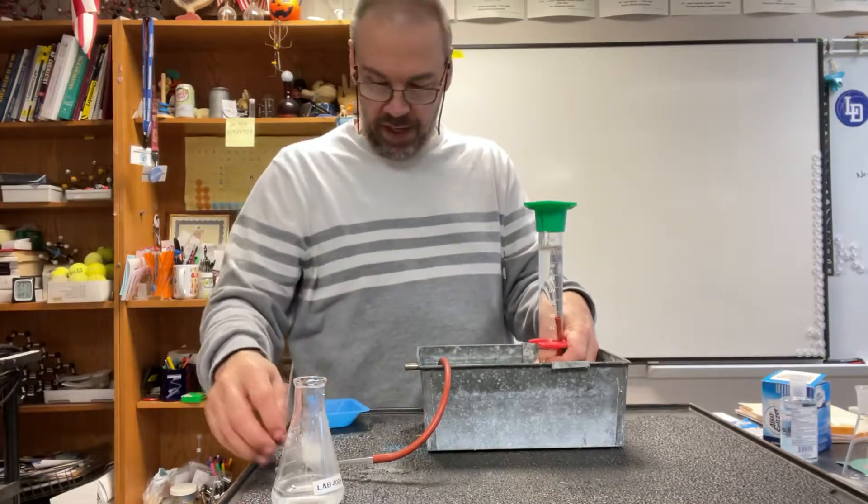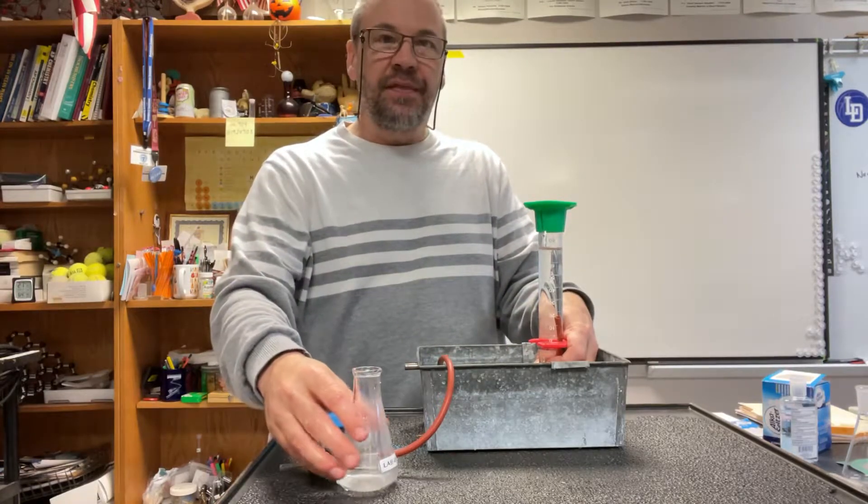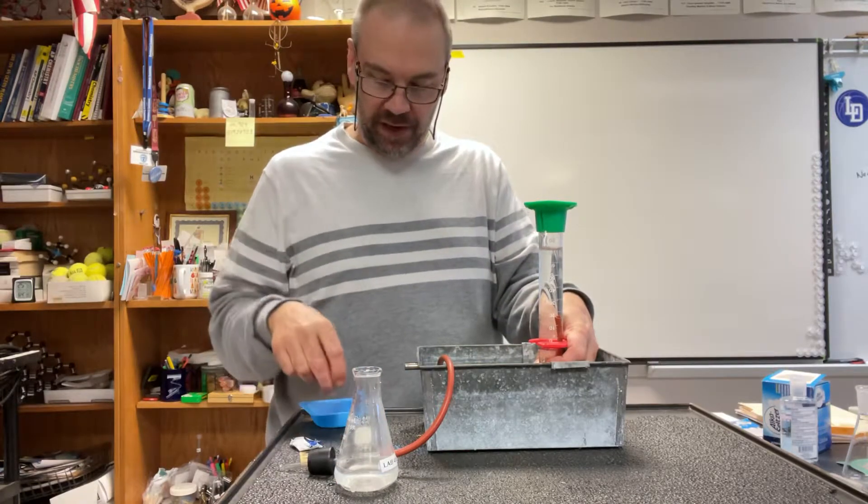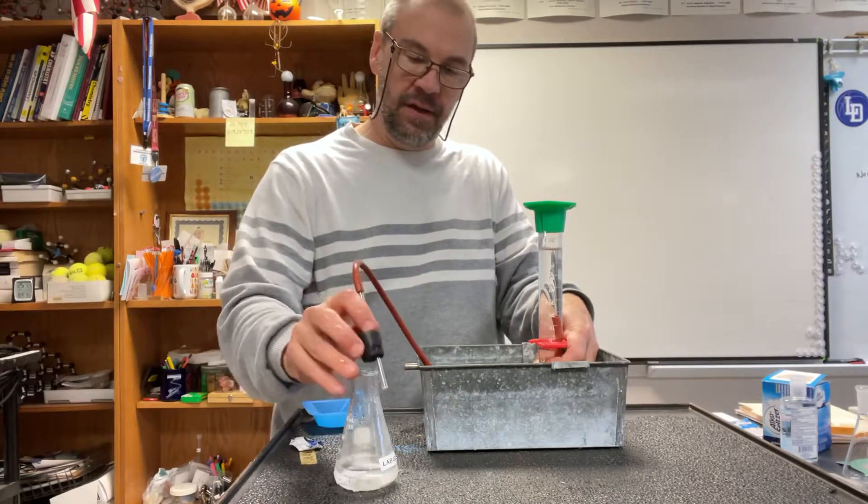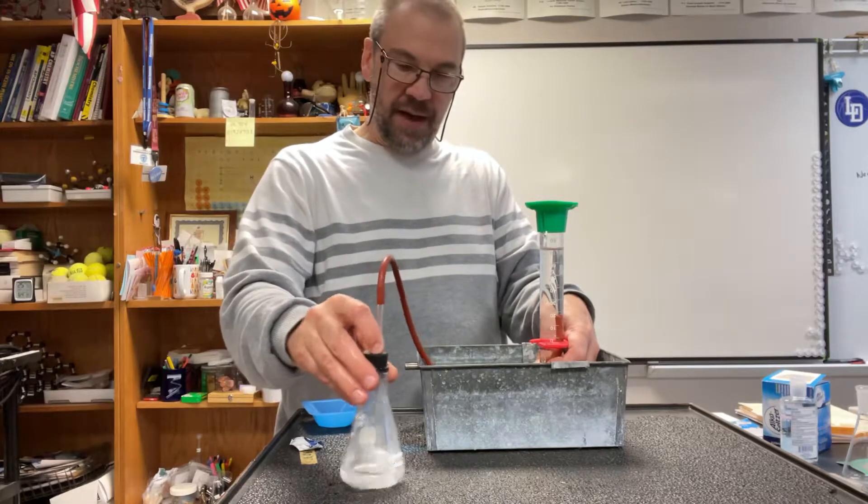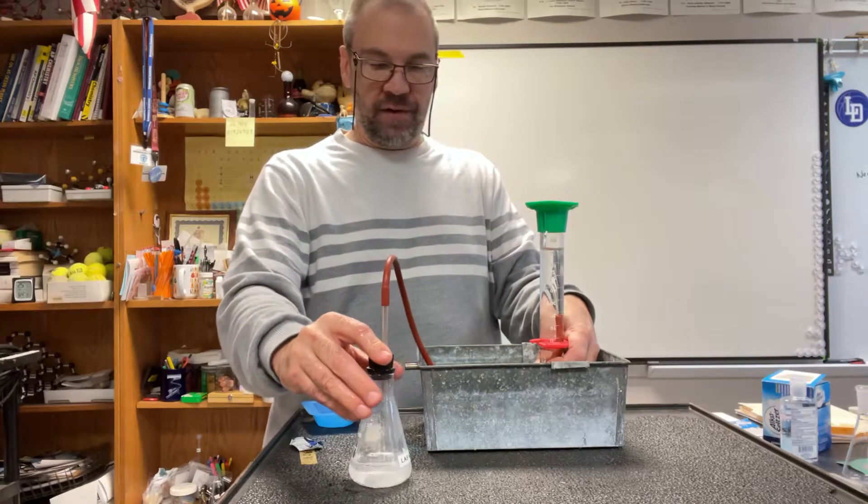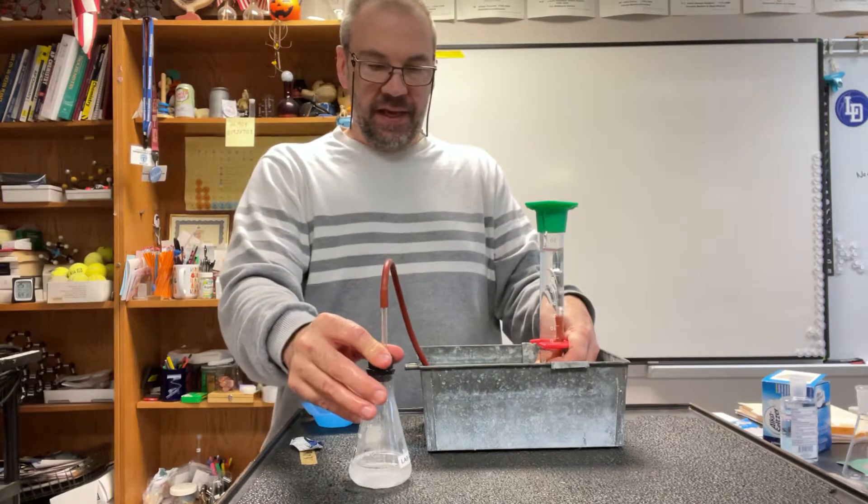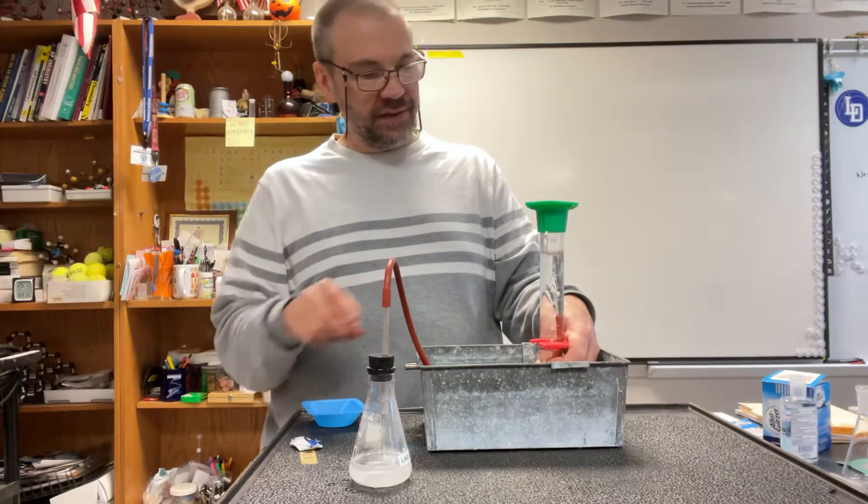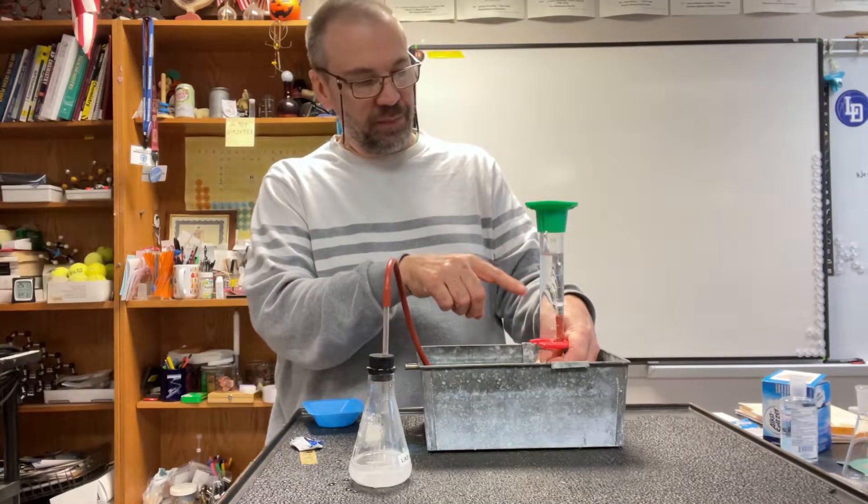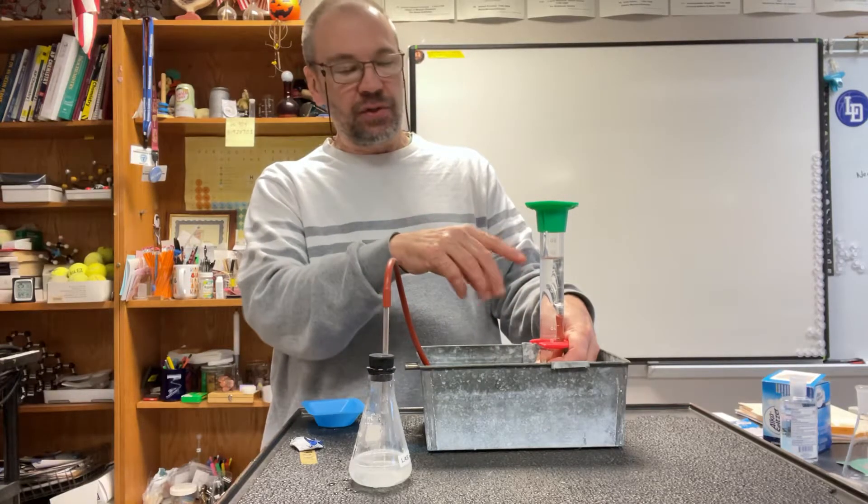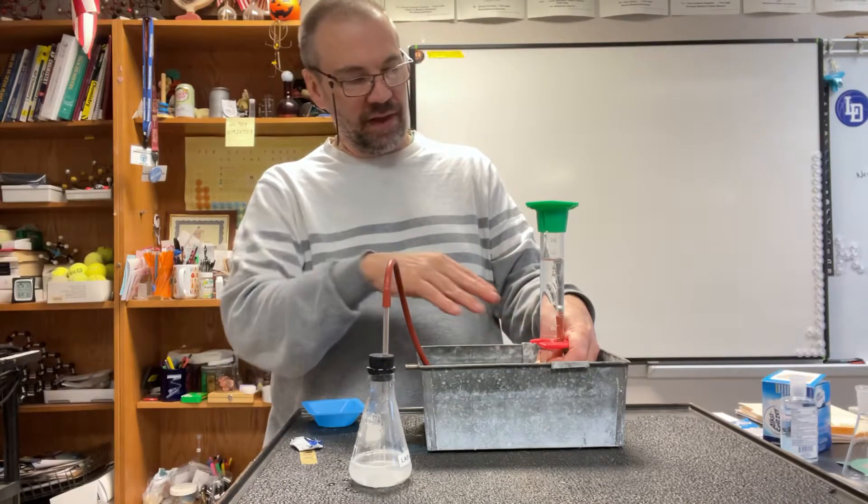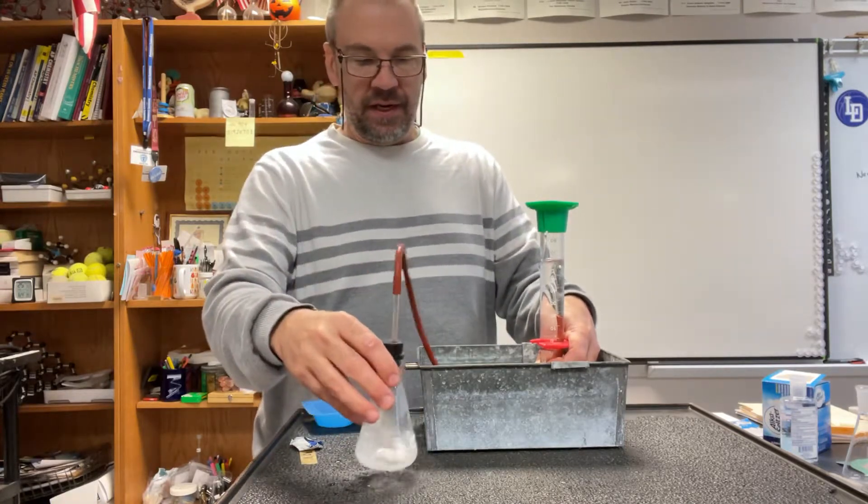What I'm going to do is hold that there because it's not staying on its own. I'm going to put my Alka-Seltzer in there and then put the top on as fast as possible. So I put it in there, put the top on, swirl it around, and that reaction is taking place. You can see the bubbles forming, so as that carbon dioxide collects inside this tube, it's pushing that water level down.